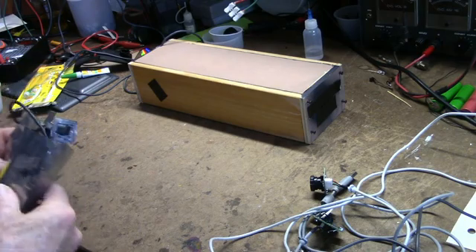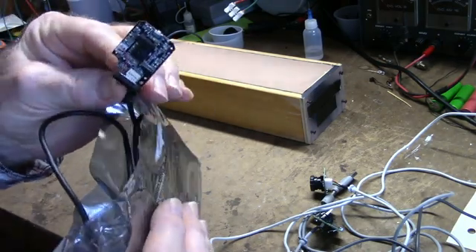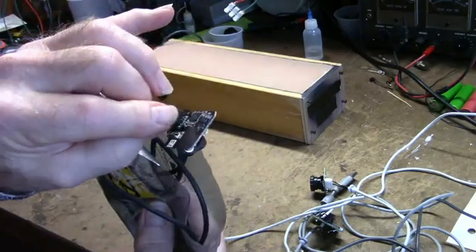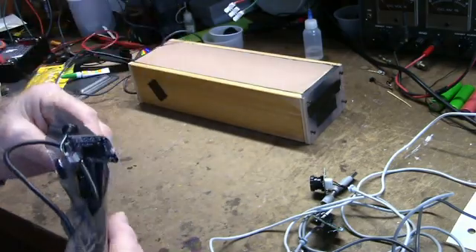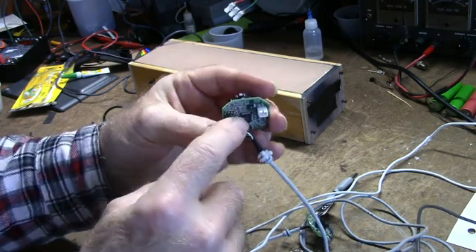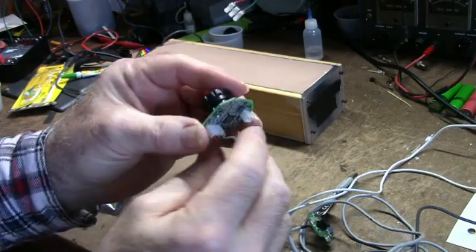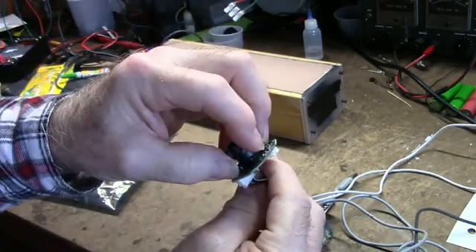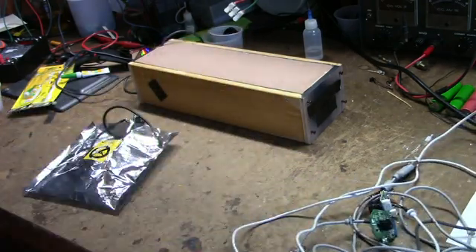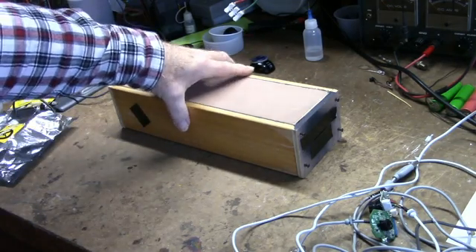Some of the ones you want to avoid, one like this one. This one has the lens and everything, the filter, all epoxied in place. You can't take it apart. There's no way to modify it without destroying it. On these, there's screws in the back that, if you remove these two screws, this housing comes off and it allows you to get direct access to the filter. This is the enclosure.